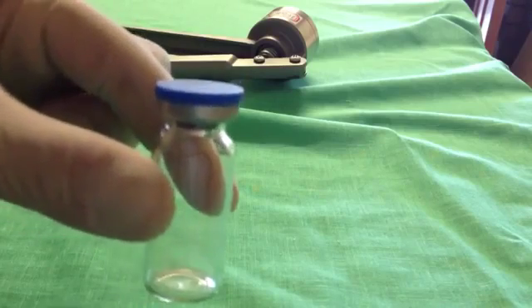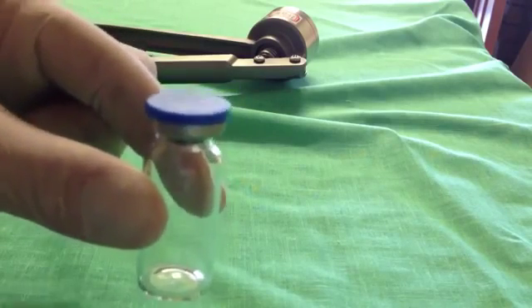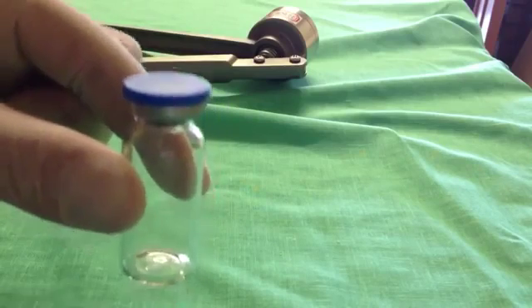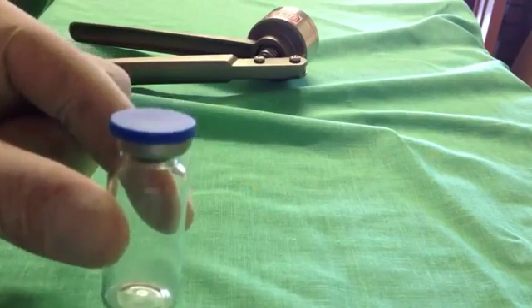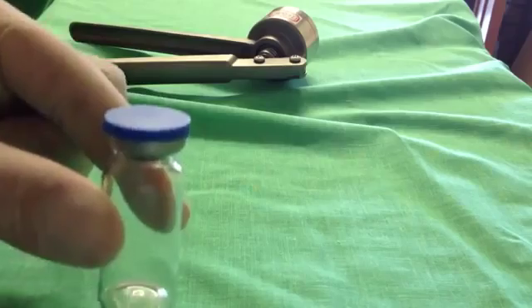Most importantly, make sure that when you put that cap on, it's level. Because if it's not, the actual crimper will crimp it unevenly and it might not be a tight seal.